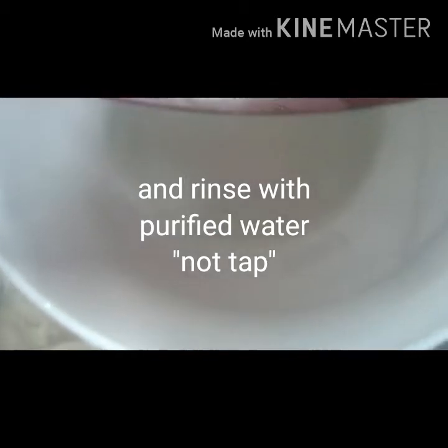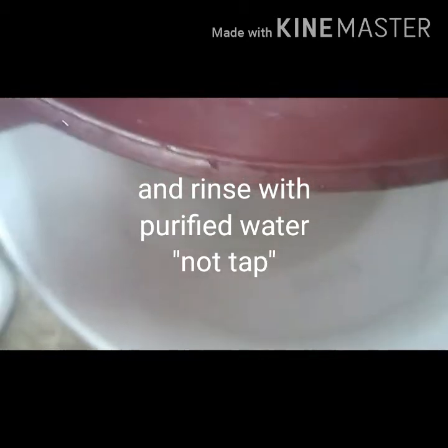Alright, so I added some water and I'm wrapping up on my first filter. It looks like crystals are starting to form down in the bucket. I'm going to wait for them to fully come out of solution and then filter them again, get the solution cooled to make sure all the crystals come out, dump off the liquid, put some new fresh water on there, and do the process again.